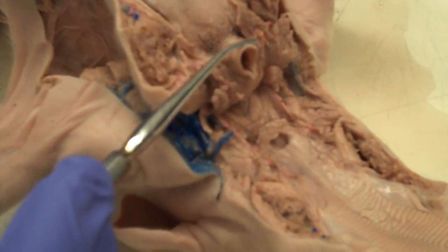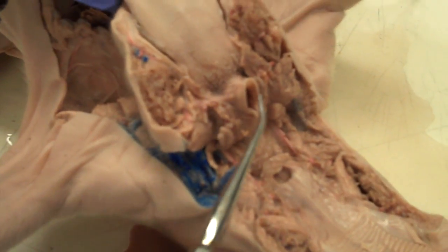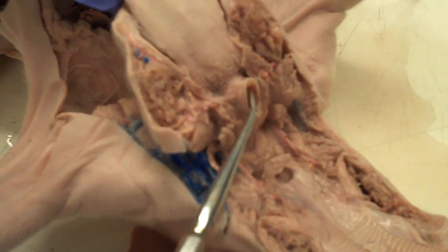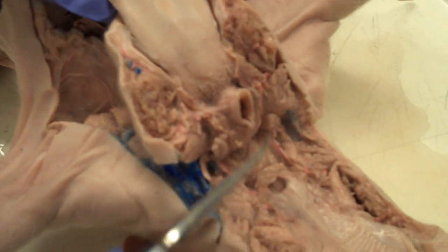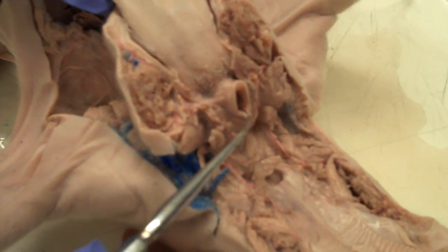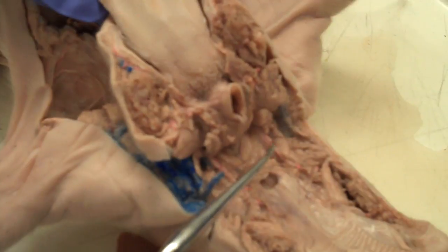The epiglottis, and the actual opening is the glottis. This area is the laryngeal pharynx.